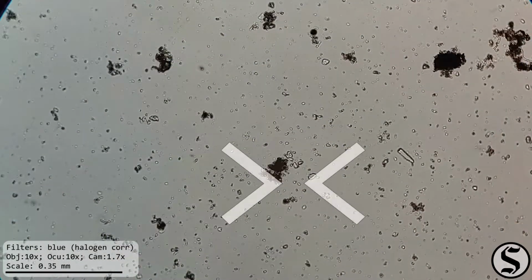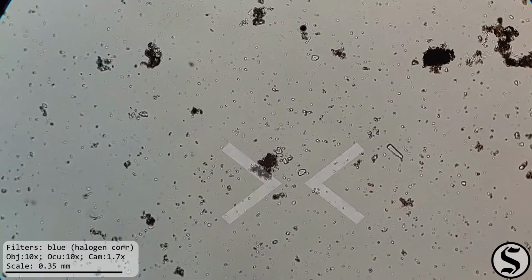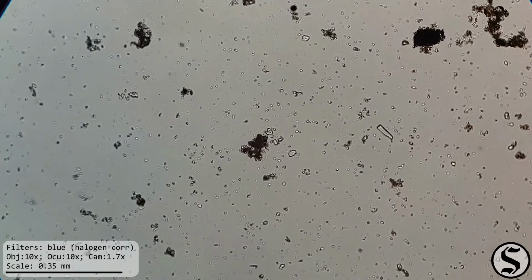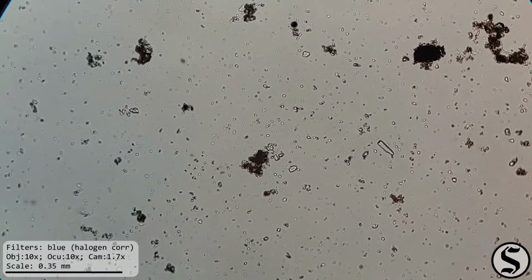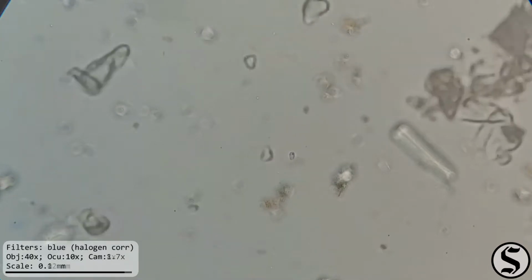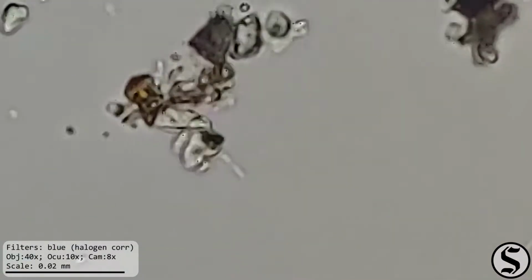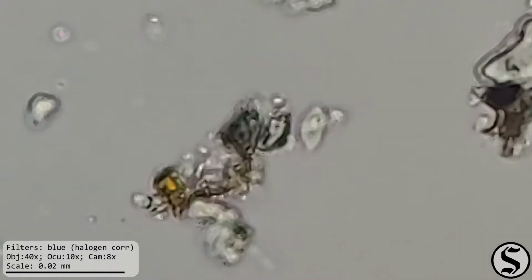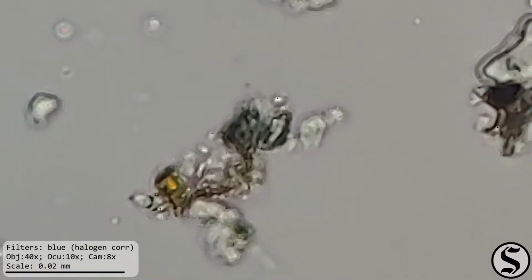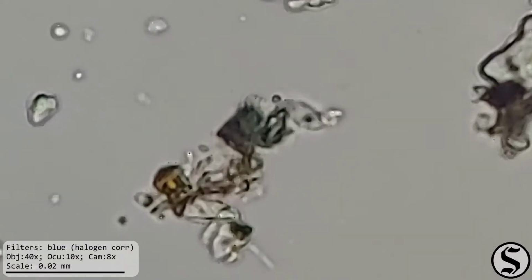Here again, in another part of the sample, we can see something very small moving around. So far, all these organisms we've been finding in this sample have been pretty small, and we can see, zoomed in again, that this looks like it's probably another heterotrophic flagellate. Here I'm using digital zoom to get us closer to this guy, and he's very determined to get into that clump of matter. I'm sure there are very delicious things hiding in there, or at least it thinks so.